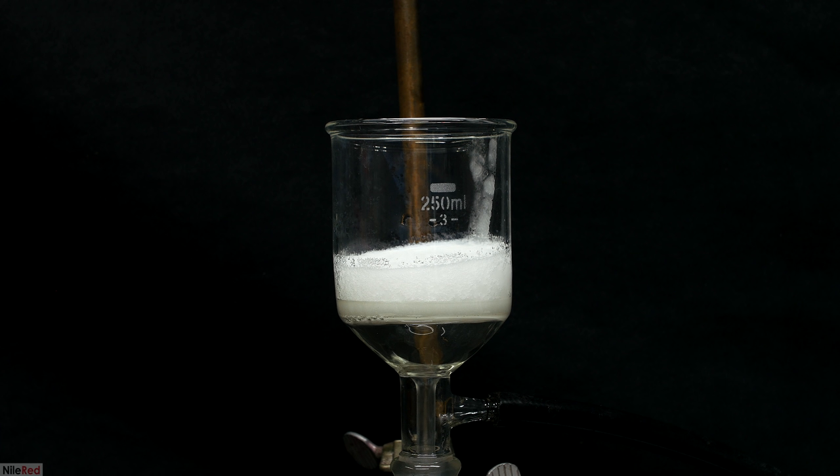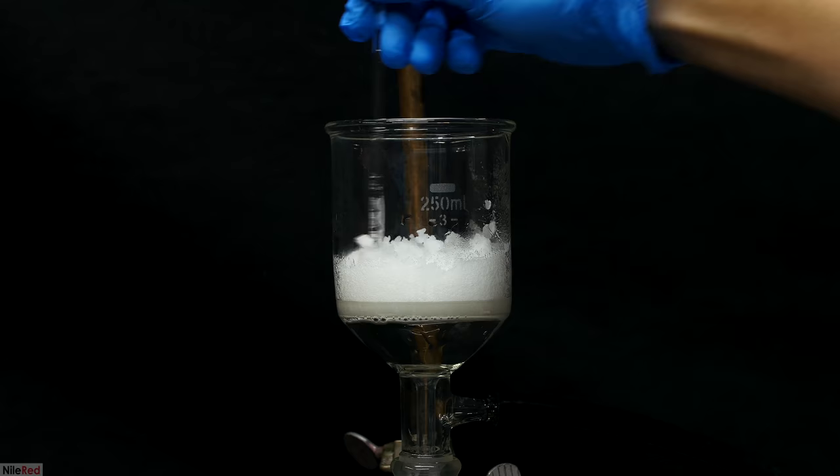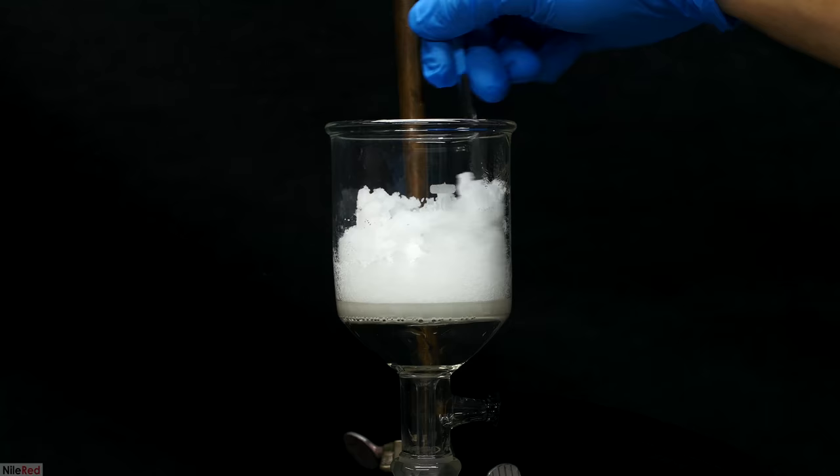Trimethylamine hydrochloride is extremely hygroscopic, which means it loves pulling water out of the air. It's able to pull quite a bit of water from the air that passes through, so it never really dries. Using a glass stir rod, I broke it up, and you can see that it's still quite damp. The product here was temporarily stored in a sealed container.